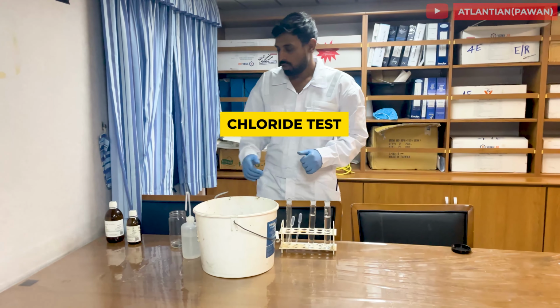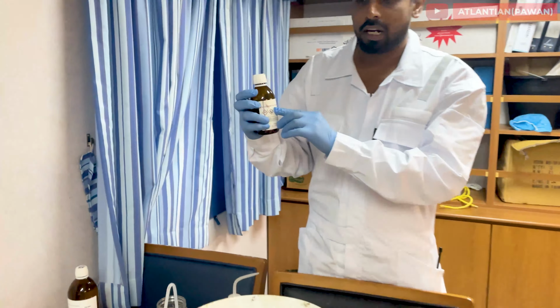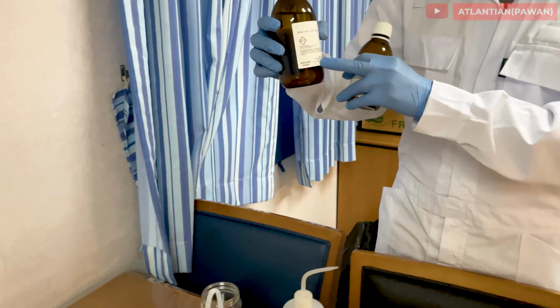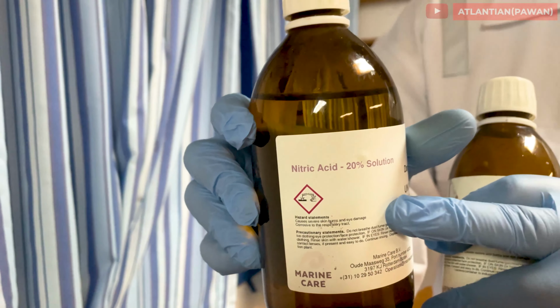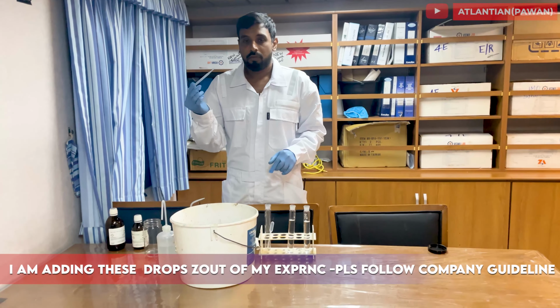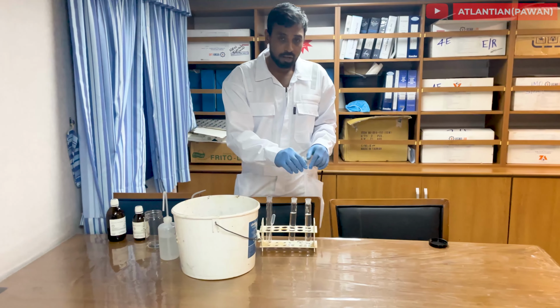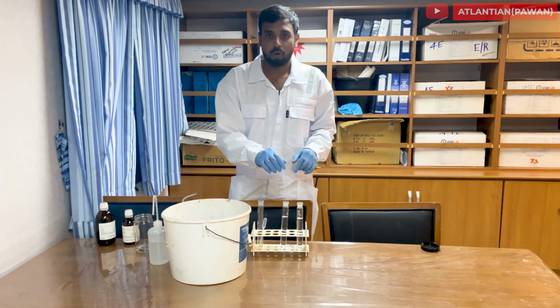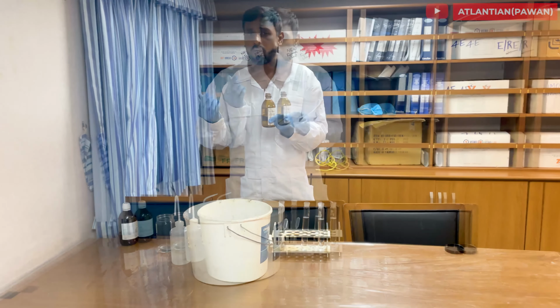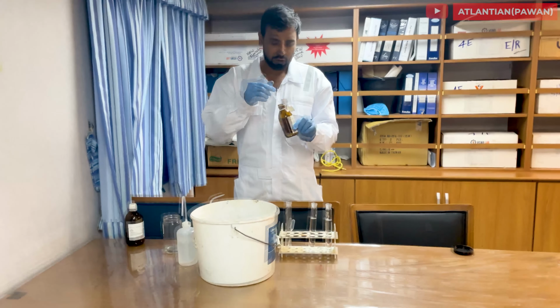There we'll perform the chloride test. So for chloride, we have to have silver nitrate 5% solution, this, and nitric acid 20% solution. So now I will add 5 drops of silver nitrate and 5 drops of nitric acid in both my reference sample and my wall wash, my tank sample. To make it more stringent, some people add 7 drops into the bottle. So that's up to you.